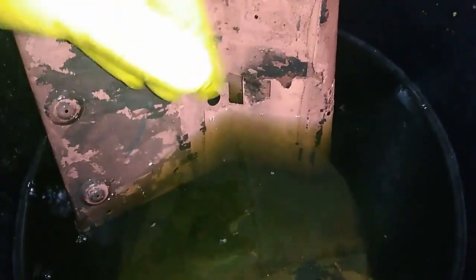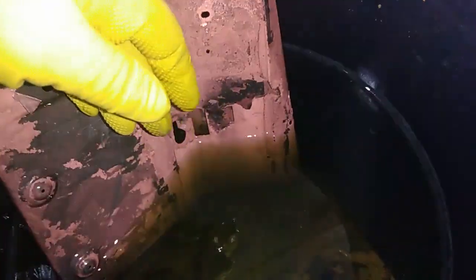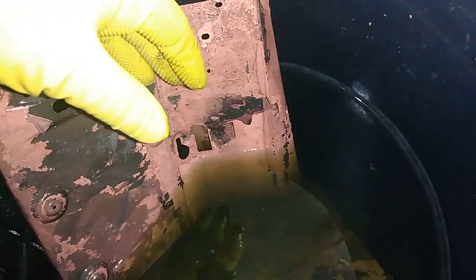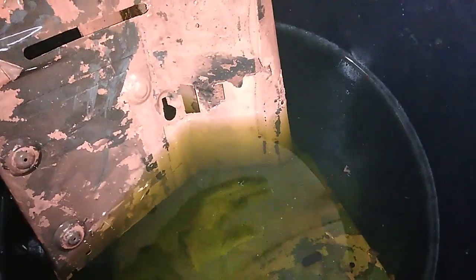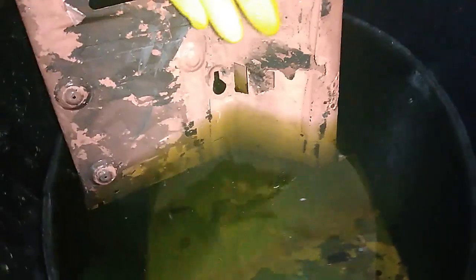What I do is put it in a five-liter plastic bucket like this. These are cheap — I get them when I buy distilled water or drinking water for my house. I put the acid inside this little barrel, and when I go to the nearest city I take that barrel and leave it at the junkyard that has the proper facilities to treat waste dangerous chemicals. You don't want to dispose of it even if this acid is safe — if you have a place that deals with dangerous chemicals, use it to dispose properly.